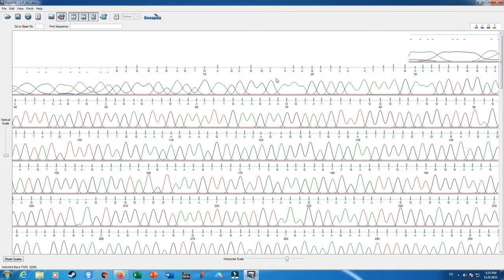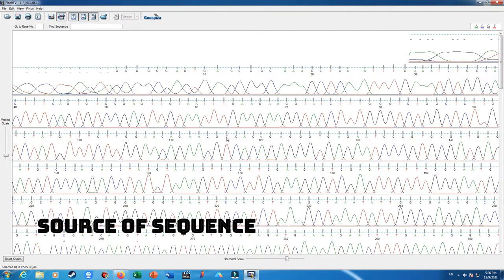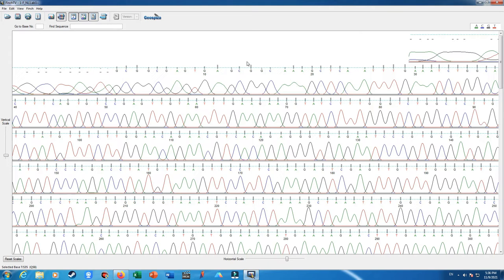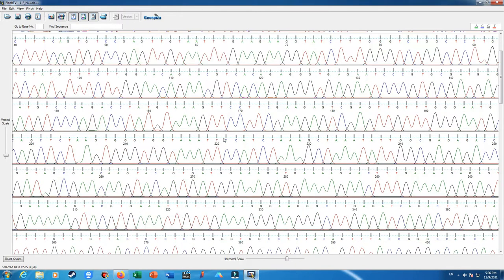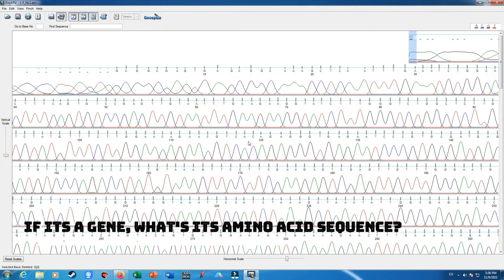So I decide to not do anything with these three adenines here, but what we can do here is use nucleotide BLAST. By nucleotide BLAST, we can do some work in here. We can determine the source of our nucleotide sequences. We can determine if this is the coding sequence of a gene. We can determine the exact gene. If we are doing some mutation study or phylogenetic study, we can also determine the single nucleotide polymorphisms, or SNPs, in here, or determine some variants or variations in our nucleotide sequences. And we can also use BLAST to determine the coding sequence span of our sequence data.